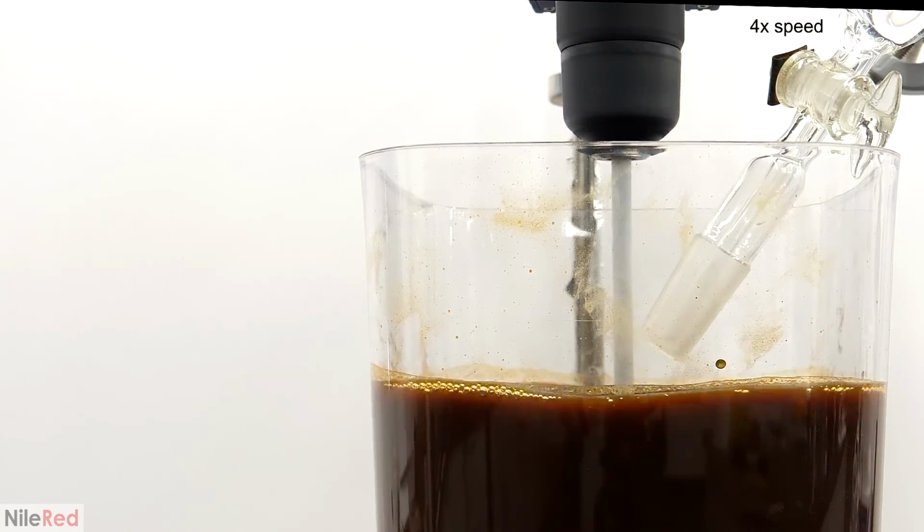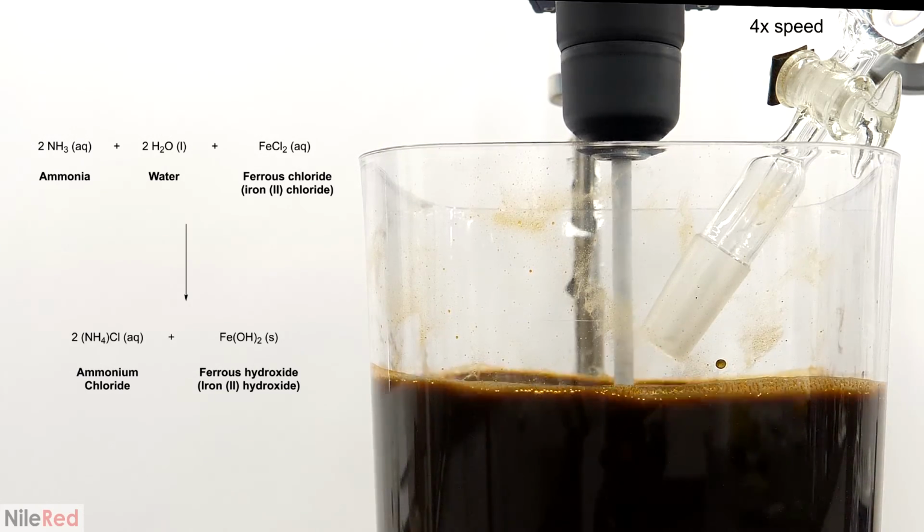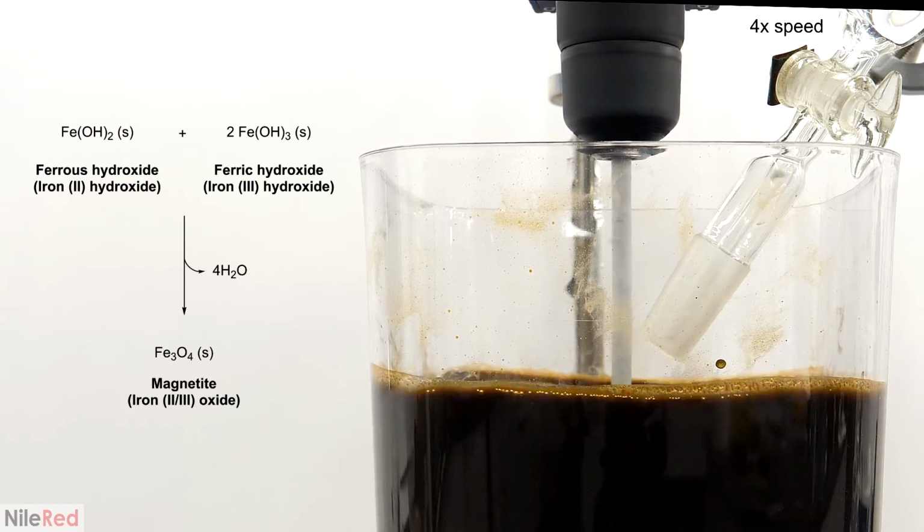As more ammonia was added, the iron 3 ions were all eventually converted, and the pH continued to increase. When it got to around 9, it started converting the iron 2 ions to iron 2 hydroxide, but these didn't exist for very long. Almost immediately after forming, they combined with the iron 3 hydroxide to make black magnetite.